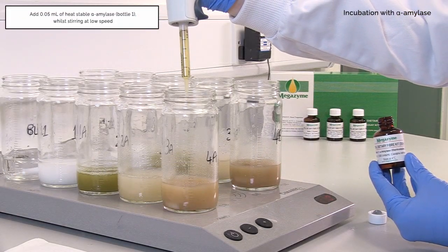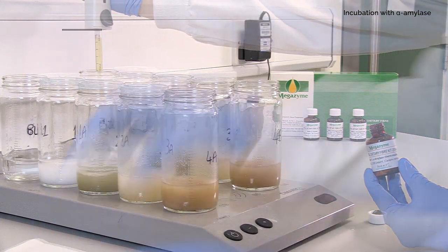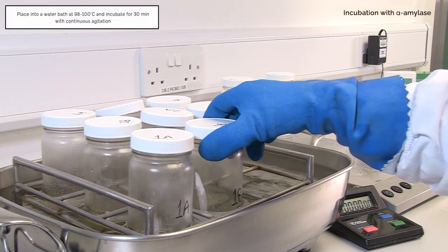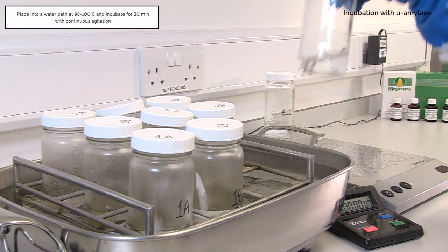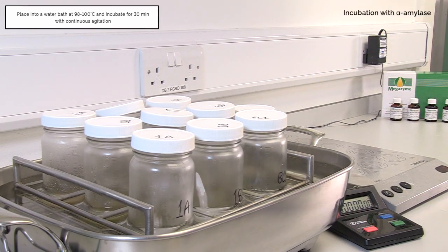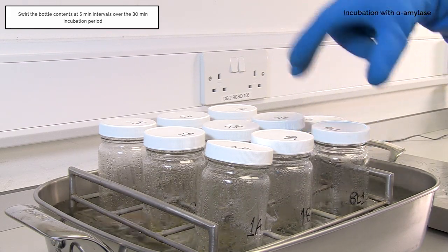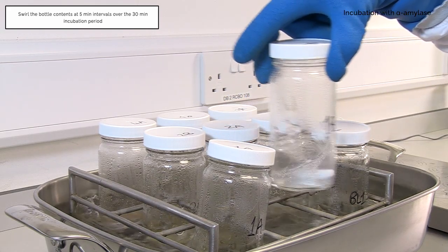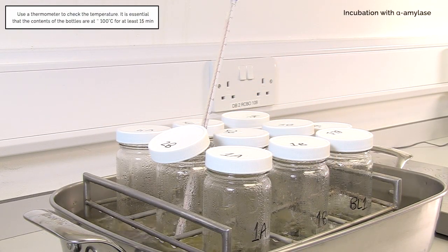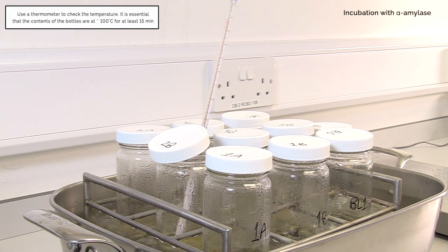Add 0.05 millilitres of heat stable alpha amylase while stirring at low speed. Cap the bottles and place into a water bath at 98 to 100 degrees Celsius and incubate for 30 minutes with continuous agitation. Swirl the bottle contents at 5 minute intervals over the 30 minute incubation period. Use a thermometer to check the temperature. It is essential that the contents of the bottles are at approximately 100 degrees Celsius for at least 15 minutes.